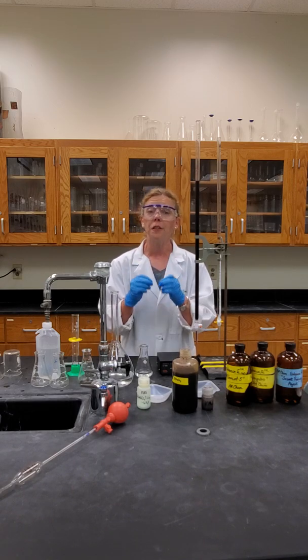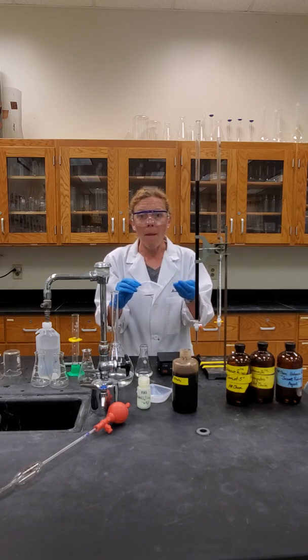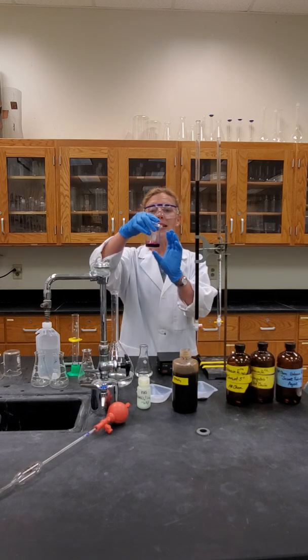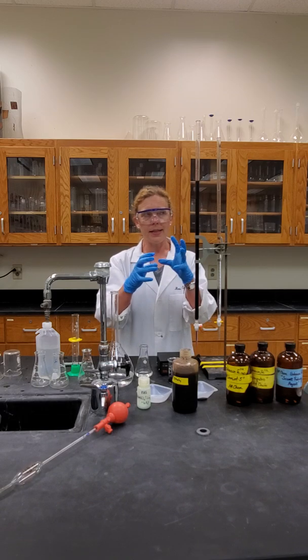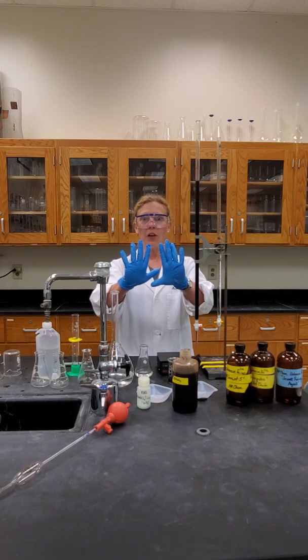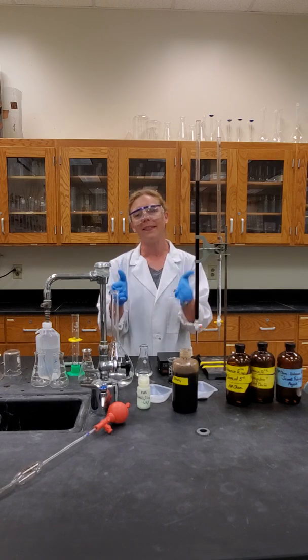Some safety precautions first. Potassium permanganate is a beautiful compound — it gives the appearance of a gray compound. However, when placed in water it shows itself as a very deep violet colored solution. That compound, potassium permanganate, reacts with anything organic to create a deep brownish compound. So we want to make sure we're wearing gloves to protect our skin, wearing aprons to protect our clothing, and fully rinsing any equipment that came into contact with potassium permanganate, because upon sitting it will stain.